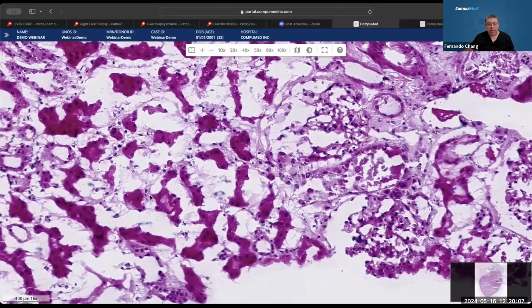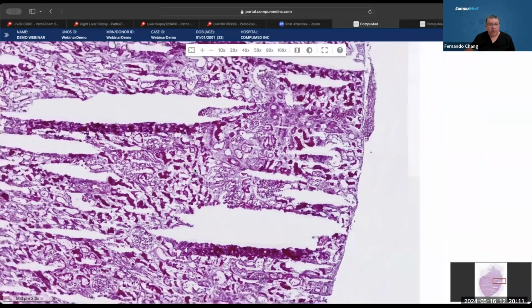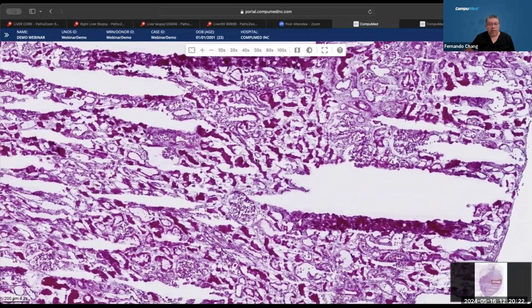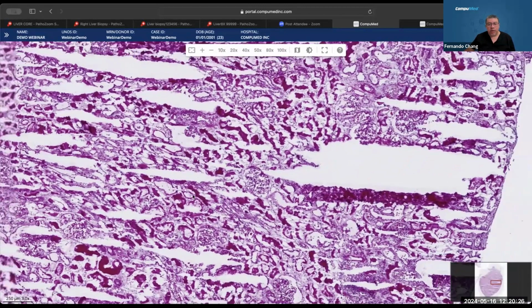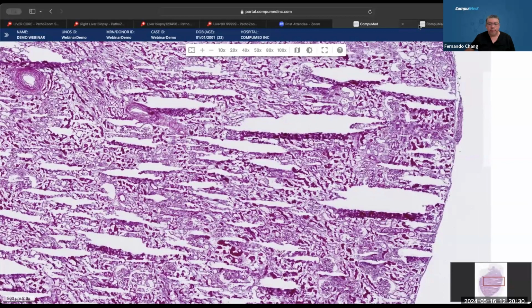So obviously the pathologist has to evaluate the glomeruli, the interstitium. In this case, the interstitium will be basically similar to the tubuli, and they're going to evaluate the blood vessels as well, and everything. And globally, the architecture changed because of the freezing artifact. Let's go to the next one.